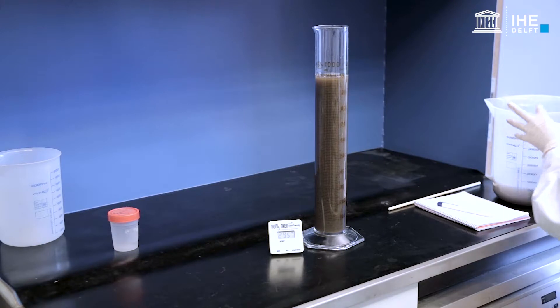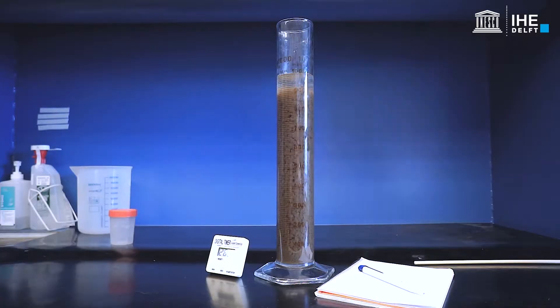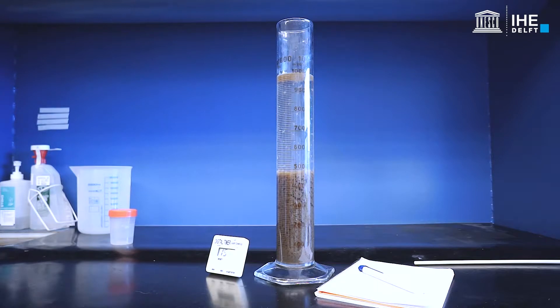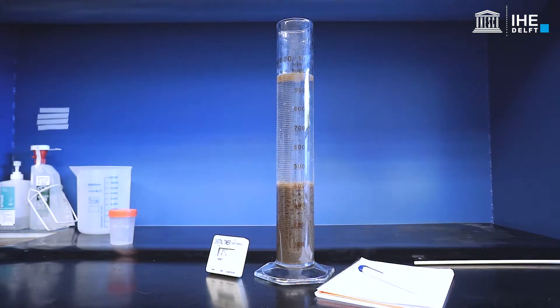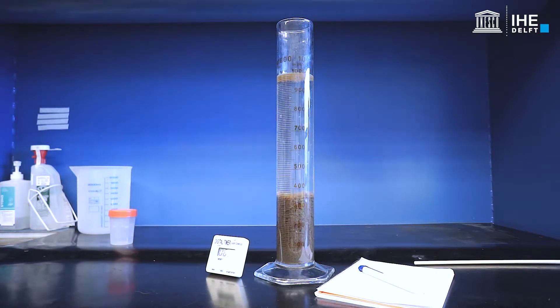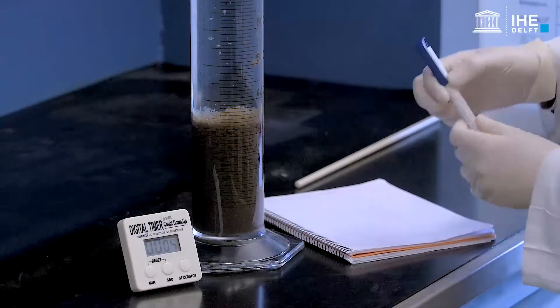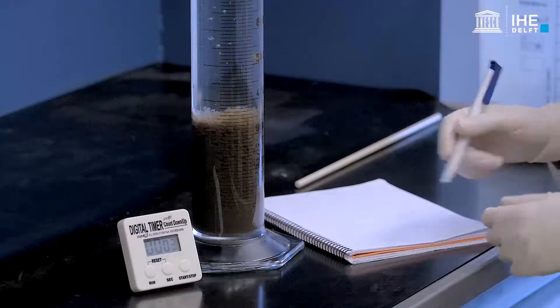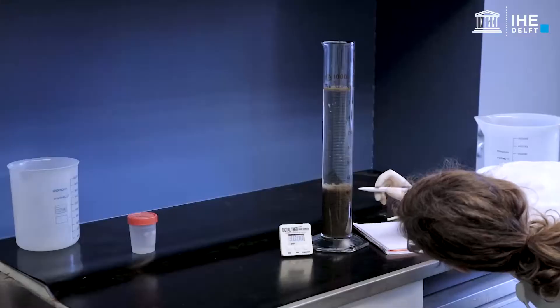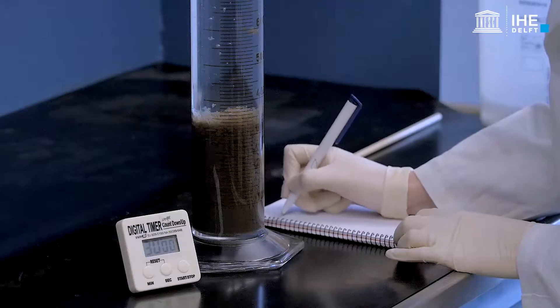Fill the cylinder until the total volume equals 1 litre and start the timer. Set the timer to 30 minutes and allow the sludge to settle. After 30 minutes, read the volume occupied by the sludge from the graduated cylinder. This is the SV30.